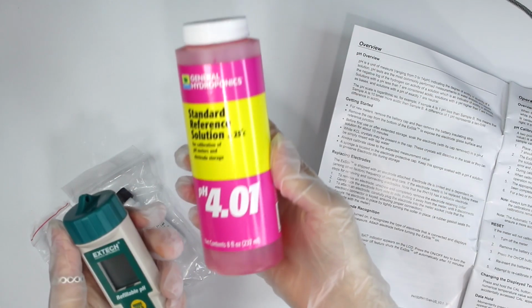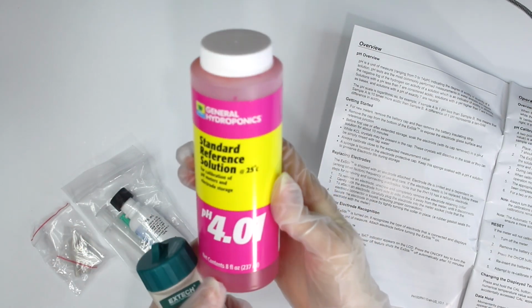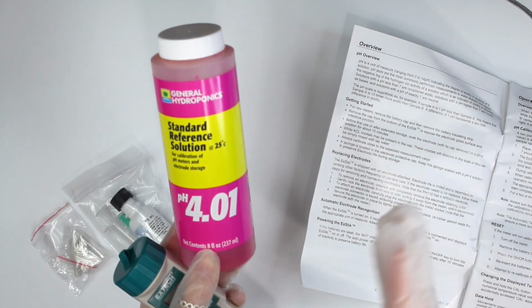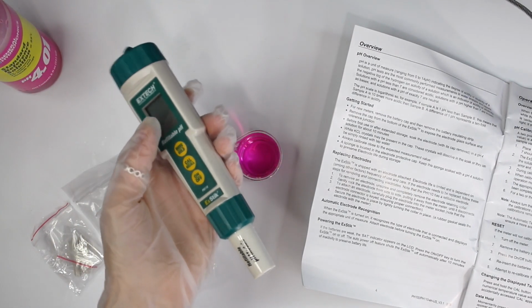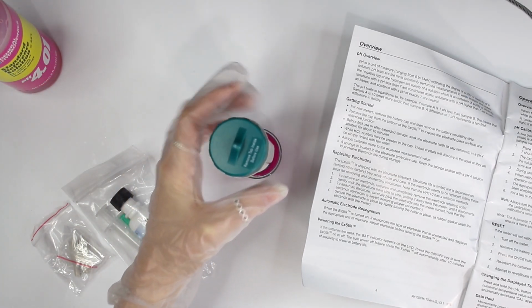What I like to use as my pH solutions are already dissolved pH solutions. You can also buy a pH of 4 solution in a powder form, and then you dissolve it in some distilled water. But I like buying the ones that are already in the liquid state. That way I can just take a beaker and pour it right in, and I don't have to worry about dissolving anything. It doesn't say to have this on, so I'm just going to place it in there, set a timer for 10 minutes and let it soak.